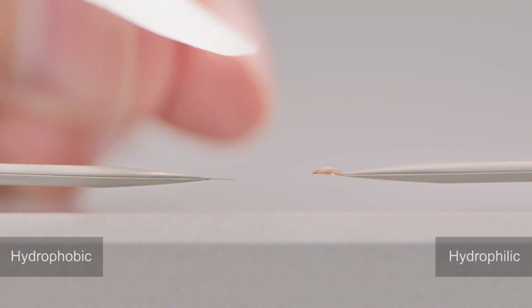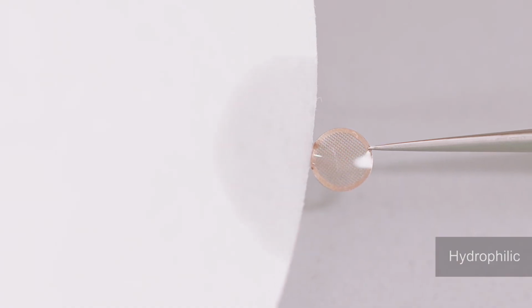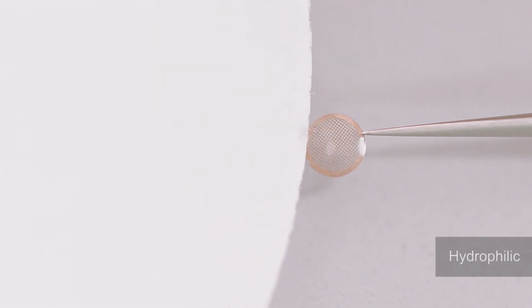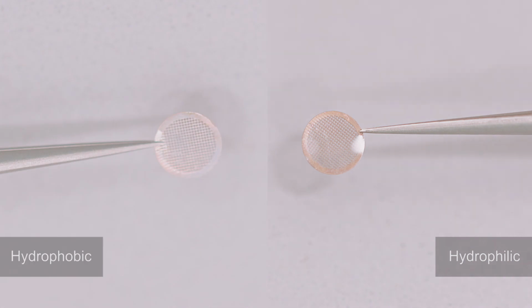Whereas if we go to the hydrophilic grid on the other side and we blot on that grid, you might be able to see, especially from the top view, that the grid will remain wet. So the hydrophobic grid is dry while the hydrophilic grid looks wet. That means that the hydrophilic grid has a film and all the holes have been filled with a thin layer of water, while the hydrophobic grid can be completely dry and empty.